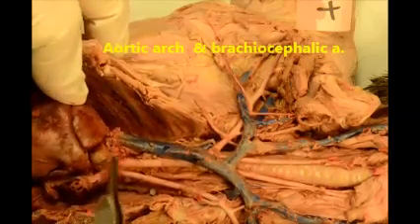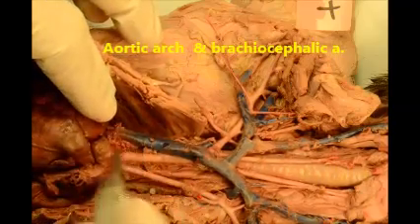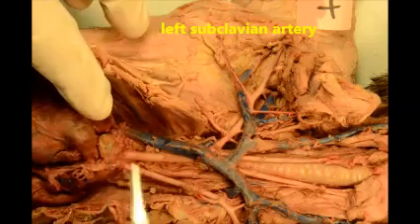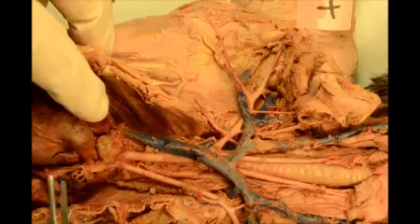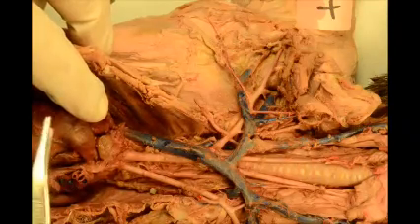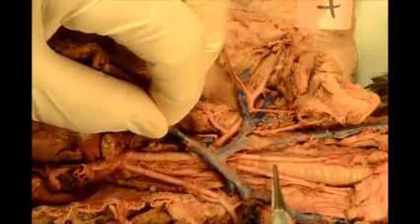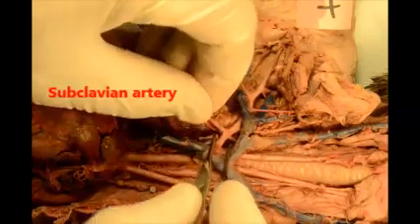Here you will see the aortic arch, and here's the heart. The aortic arch gives rise to the brachiocephalic, which is the first vessel that comes out of the aortic arch. The other vessel that comes out of the aortic arch is the left subclavian. I'm going to stick to the right side, because once you get past the brachiocephalic, the arteries as they approach the arm are the same on the right side as on the left. Here's the brachiocephalic, here's the left common carotid, the right common carotid, and here's the subclavian.